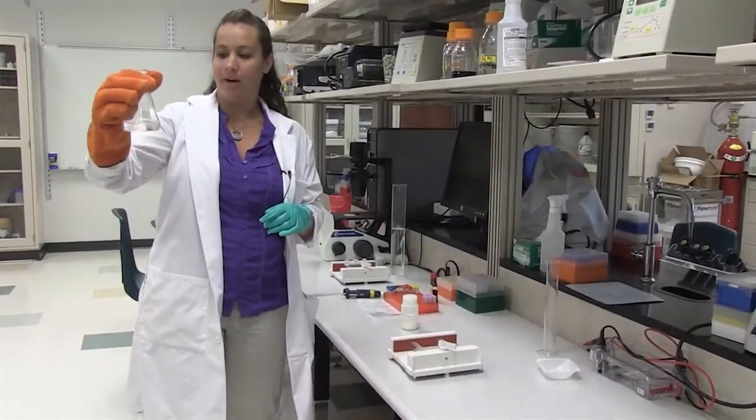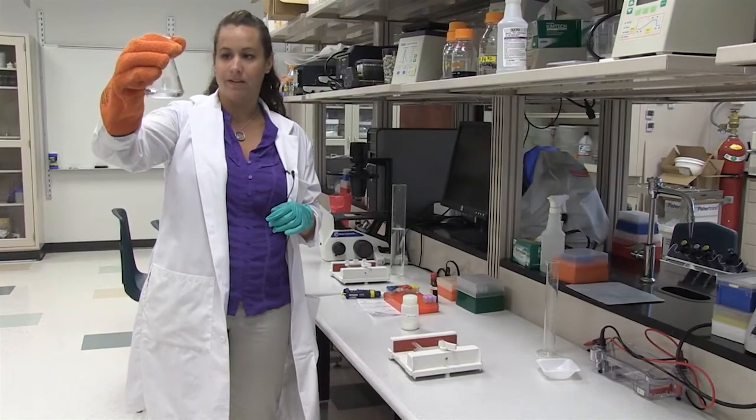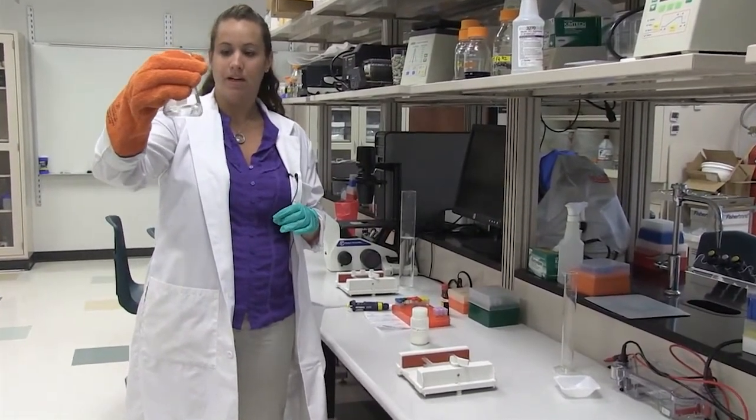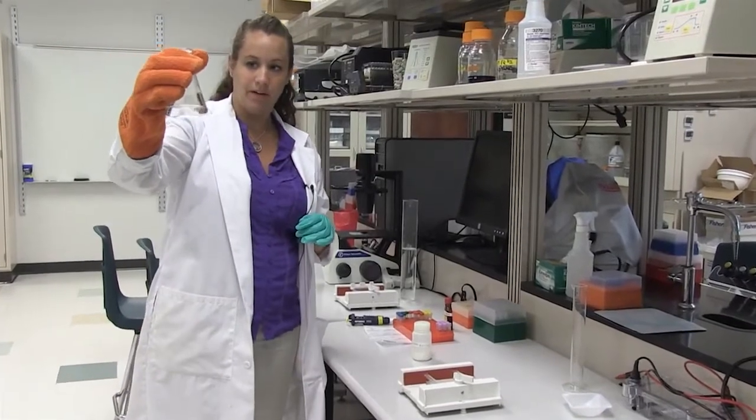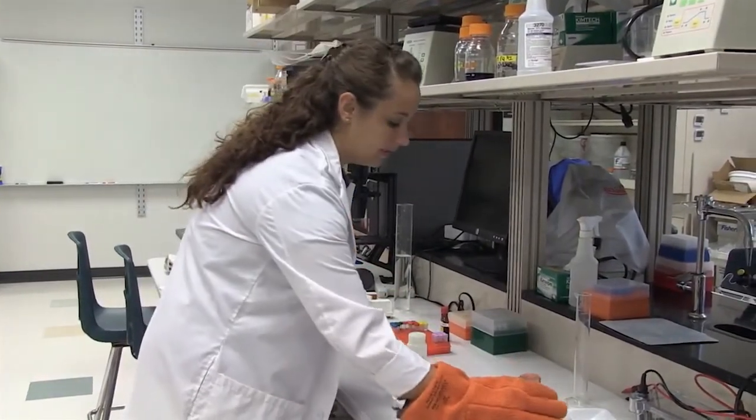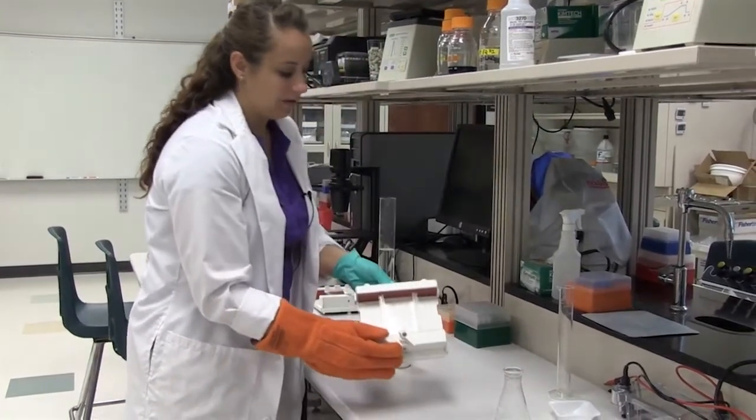Now that we've come back from the microwave, you can see that the agarose is nice and clear. That's our sign that the agarose has dissolved in our buffer. Now that it is nice and clear, we are going to go ahead and pour it into our tray.